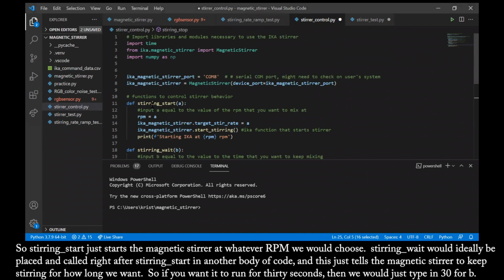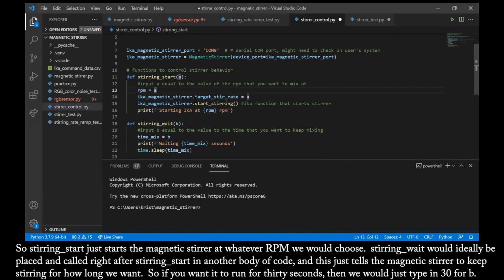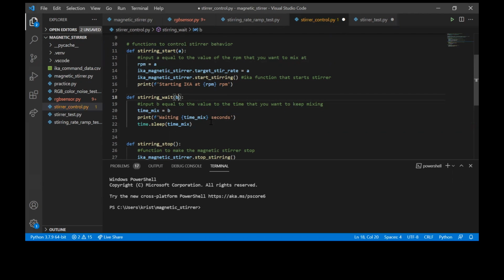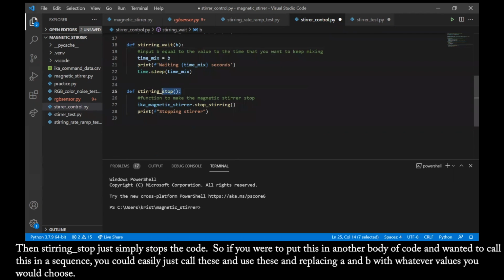So stirring start just starts the magnetic stirrer at whatever RPM we would choose. Stirring wait would ideally be placed and called right after stirring start in another body of code. And this just tells the magnetic stirrer to keep stirring for how long we want. So if we want it to run for 30 seconds, then we would just type in 30 for b. And then stirring stop just simply stops the code.